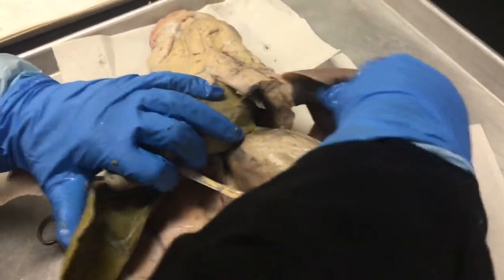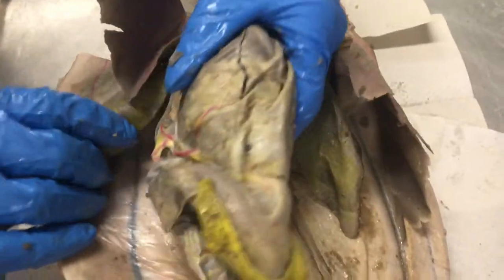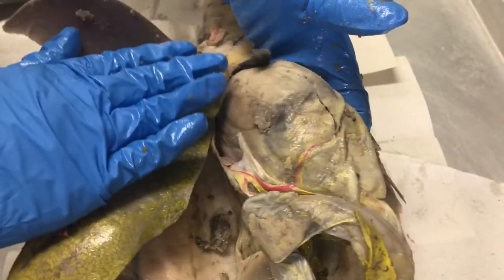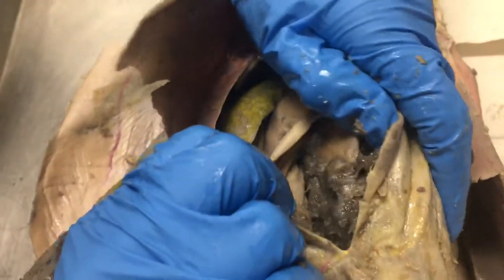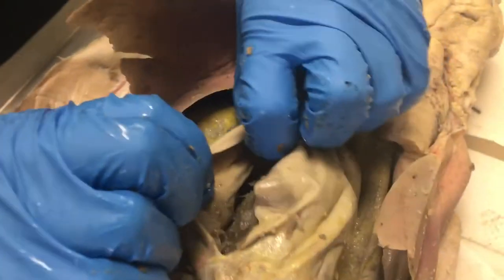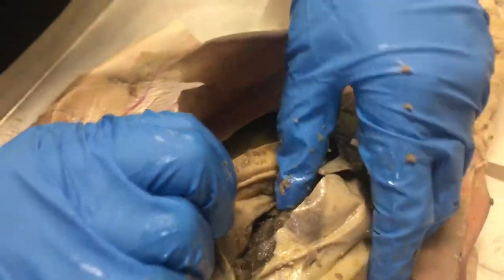The stomach is pretty much the second largest organ, and this is the entire stomach right here. If you open it up, you can see these little folds inside — there you go, you can see the folds.